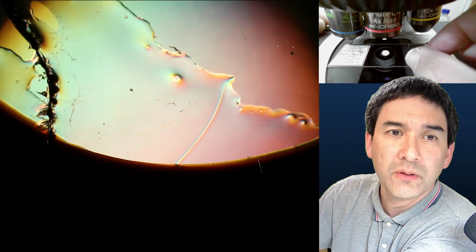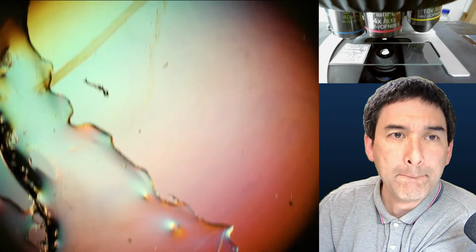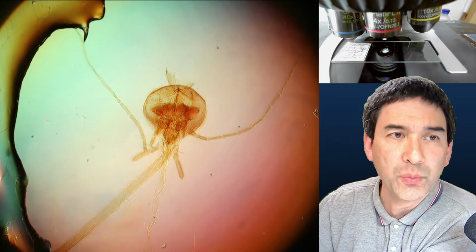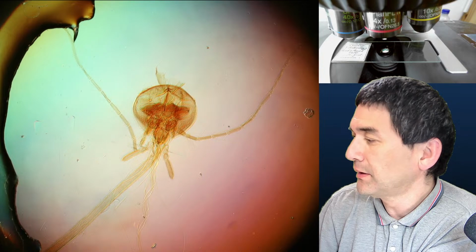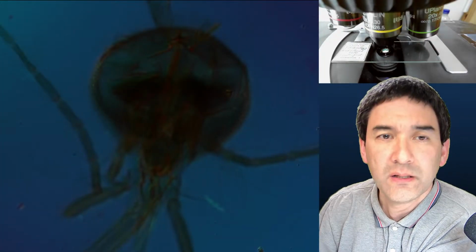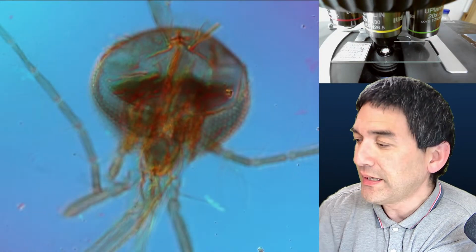Feldzahl. That is the field of view. I will talk quickly about this as well. But this is also one of those specimens that we looked at last week. Okay, but I just wanted to quickly show this to you again.